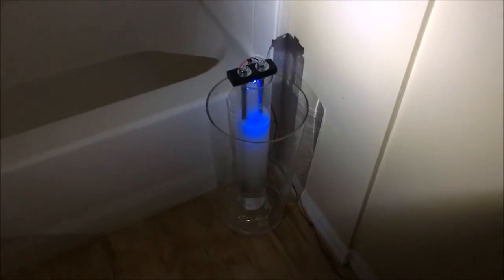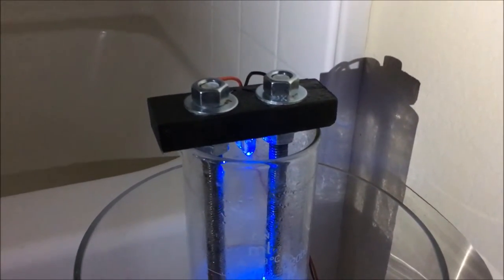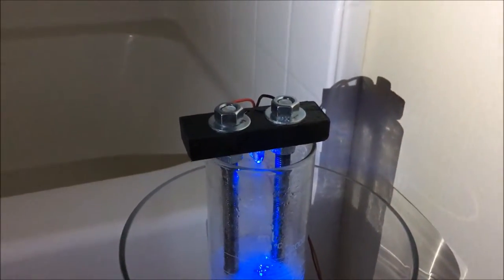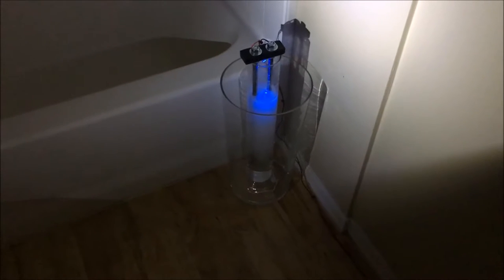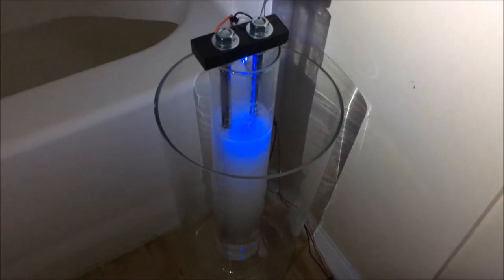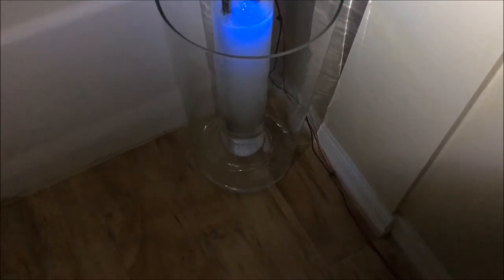I've done a bit of stylistic adjustment to my setup. I spray painted the wooden holder for the two electrodes black and added a couple of LED lights to the underside of the wooden holder, just to make it look a little more sciencey if I have friends over to look at this project. I also put it inside an external glass vessel to make sure that if the glass breaks or if it spills or boils for any reason, it won't spill sodium hydroxide solution all over the laminate flooring.